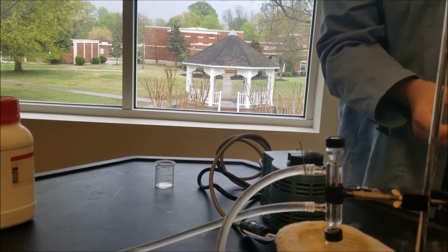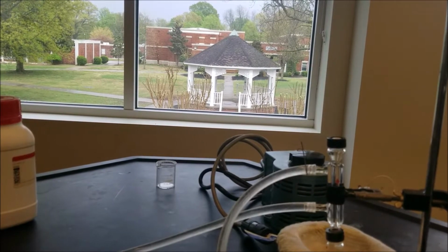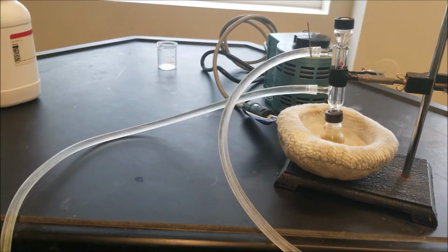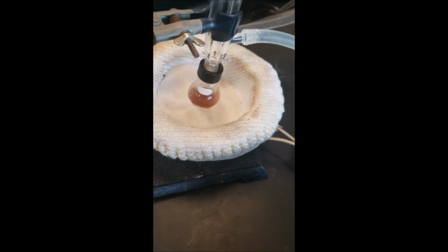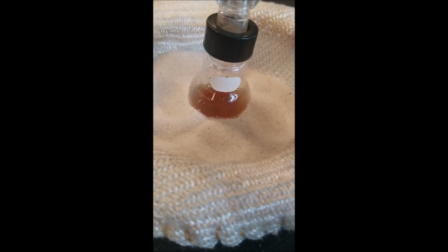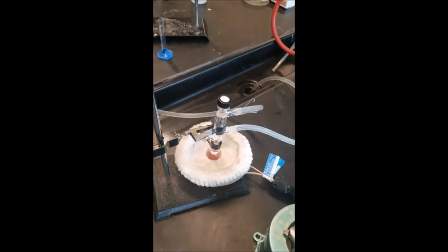Now I just let this heat with a gentle boiling for, I believe, about an hour. So you're going to heat in there once it begins gently boiling, for about an hour. This is after maybe only 16 minutes or so. It's already much darker. You can see it's kind of refluxing up the sides and down, but still gonna give it at least an hour. Up until now, as rough as this has been, there were still no horrible errors.